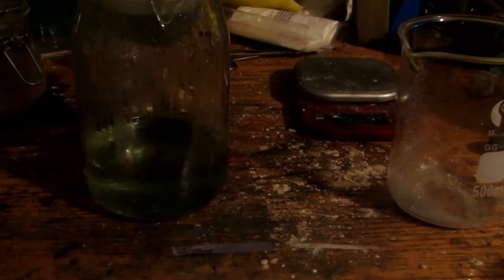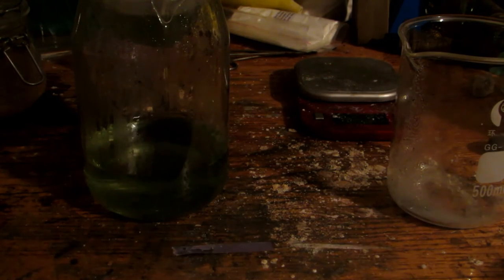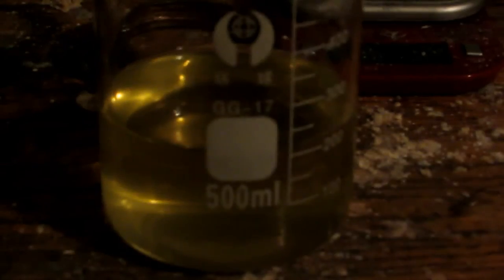You can see there's that little bit of silicon dioxide at the bottom which never reacted, and then our solution of sodium silicate. I'll rinse out this beaker, transfer the solution of sodium silicate, and boil it down to re-obtain the crystals. Already our solution is starting to look much less green. This is most likely because the compound that gave us our iron impurity is actually iron hydroxide.